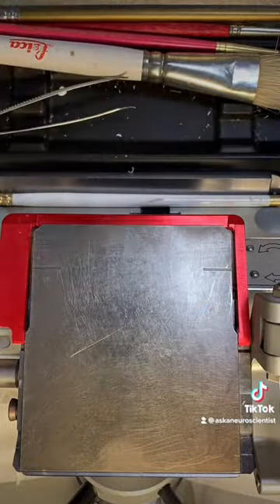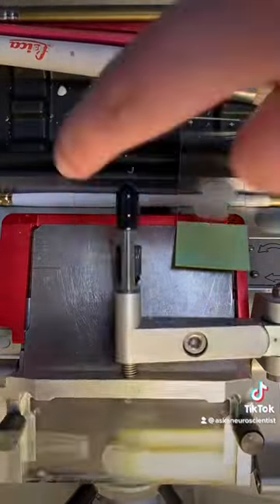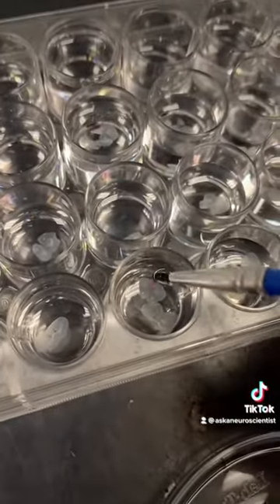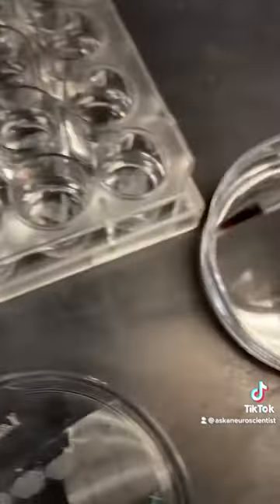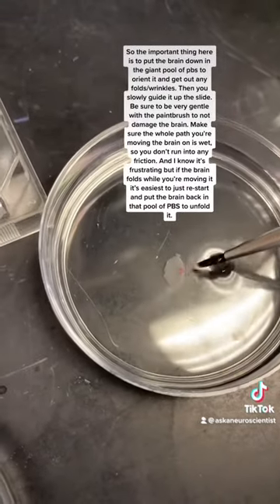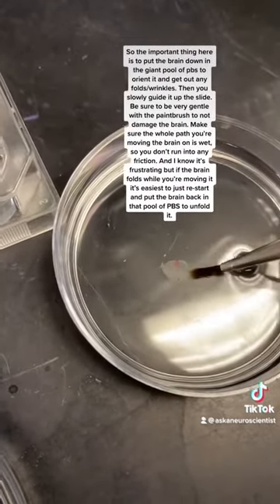There's another method people use where instead of putting the brains onto slides, they put the brain into a liquid — usually PBS or a specific stain — and I'll show how you get those onto a slide in a second. These brains were in PBS. You'll notice they're a lot smaller than the brains from earlier, and that's because these ones are mouse and the ones from earlier were rat. The pink you're seeing is just a dye.